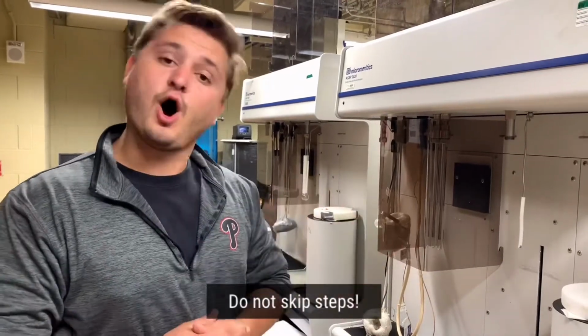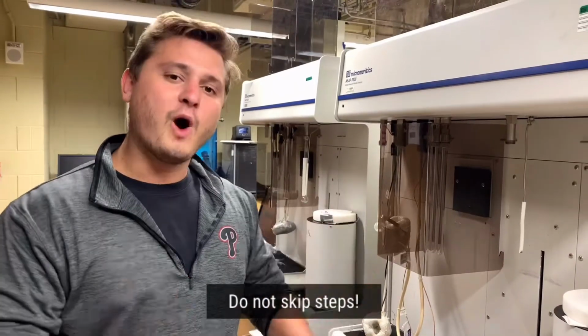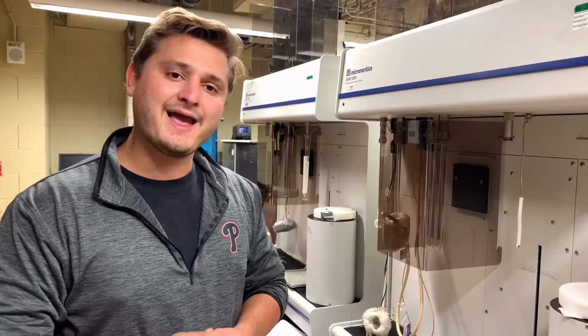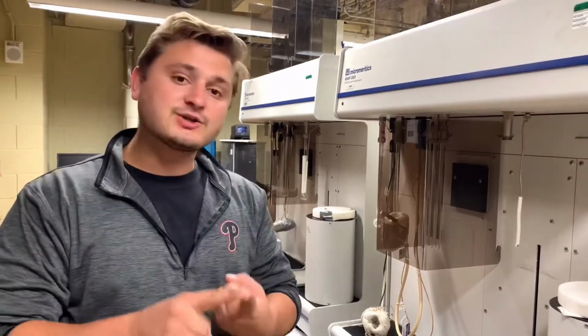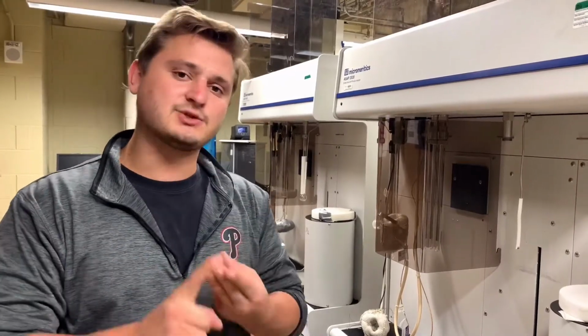The final thing is, do not skip steps. There is a skip button on the computer program, but you do not, under any circumstance, want to skip steps unless instructed by Micromeritics or by an experienced service technician. Dry your sample beforehand, no DMF, DMA, or DMSO as your last solvent, and do not skip steps unless instructed by a Micromeritics service technician.